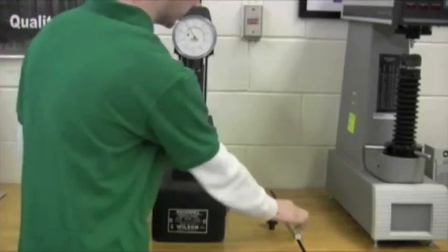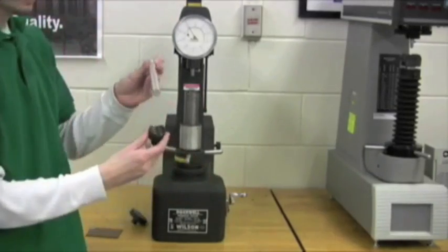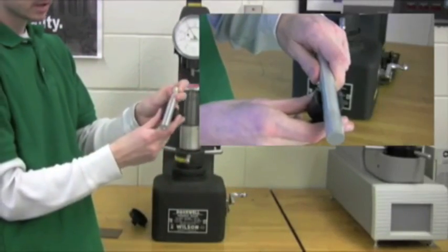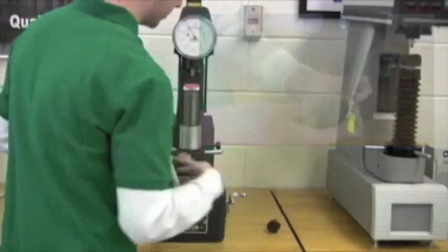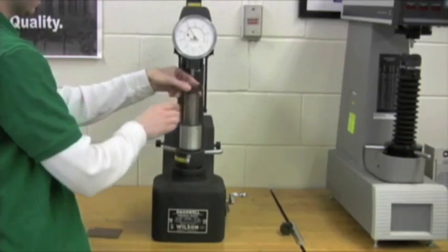But for a piece of round stock like this, we have other kinds of anvils that we place on here, like so. But we're going to be doing a flat piece of material right now.